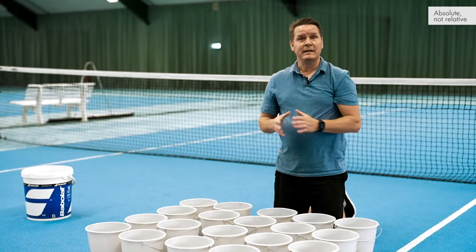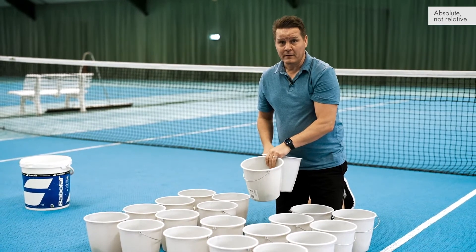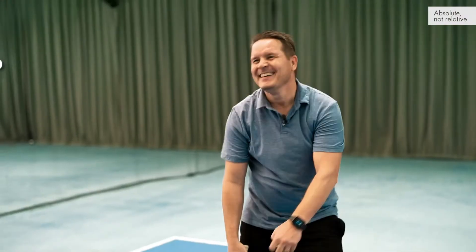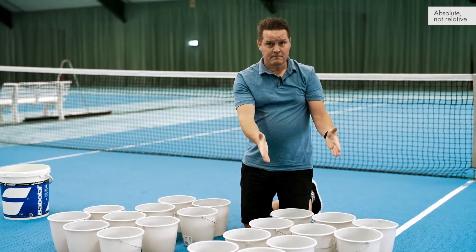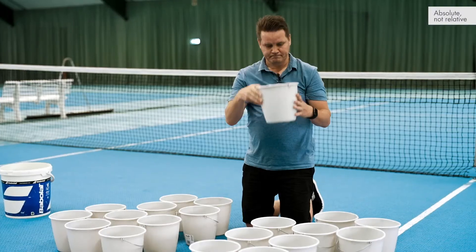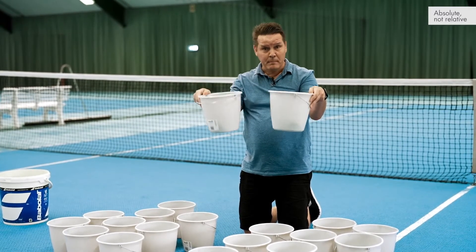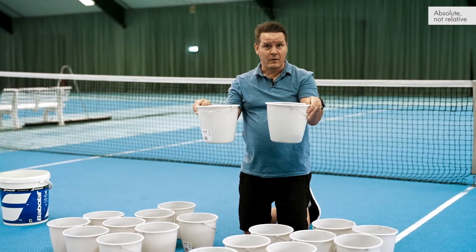That means the volume needs to be exact, which is why we are implementing the volume precision factor. Here you have two nano wells — well A and well B. If I fill this one with water and fill the other with water and then measure the volume, it will not be the same, because they are made differently and are not perfect — the same conditions apply to our nano wells.